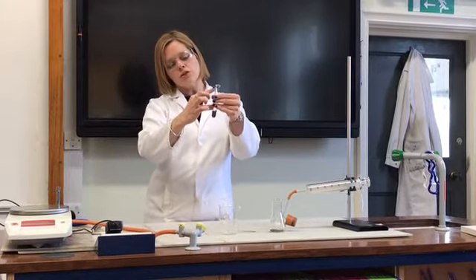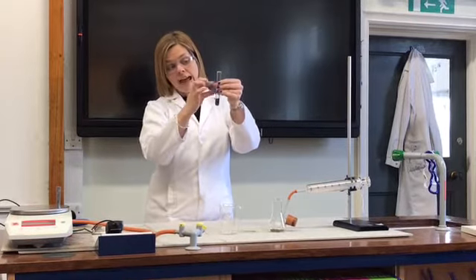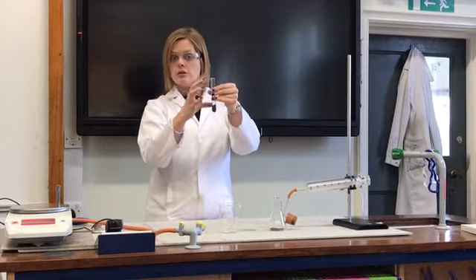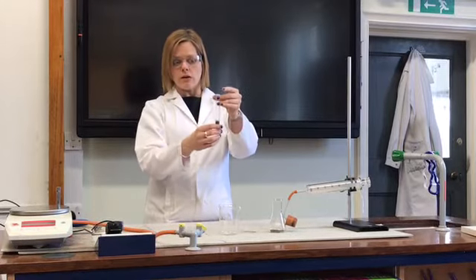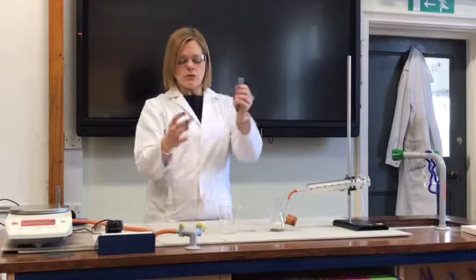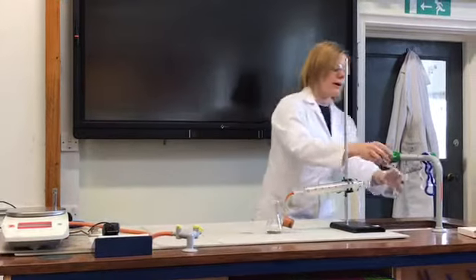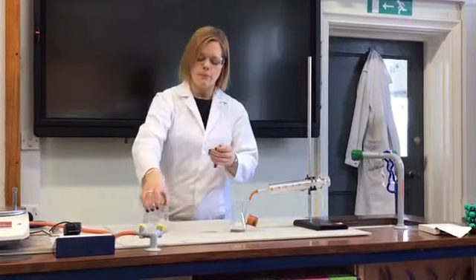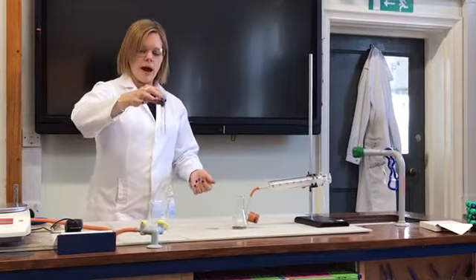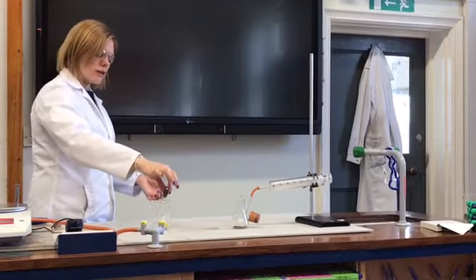And if this takes the oxygen from the air above it out, then we can use that as a measure of the volume of oxygen that was in the air column to start with. So in order to do that, take a beaker and pop some water in the bottom of the beaker, not too much, but pop a bit of water in the bottom of that beaker. And then upturn this test tube like so.